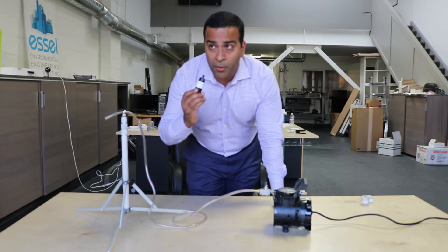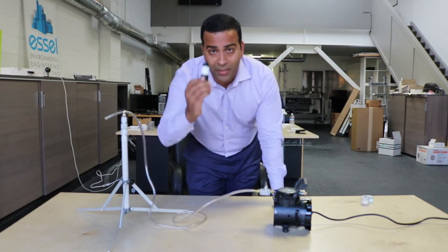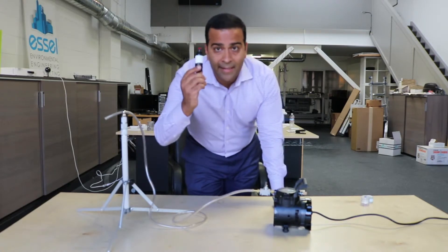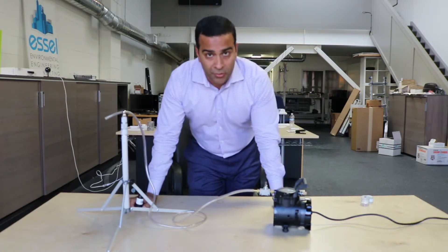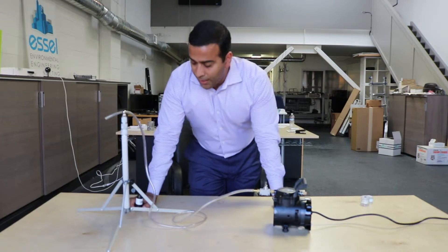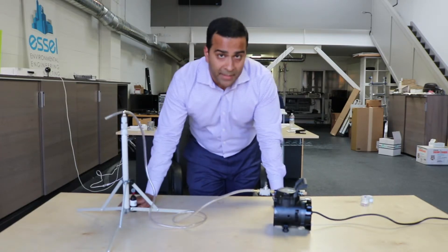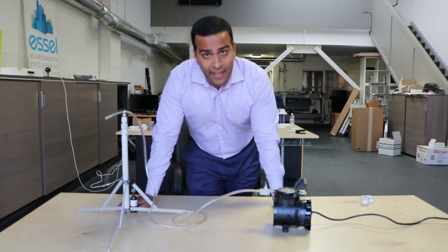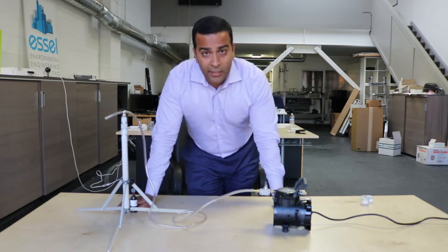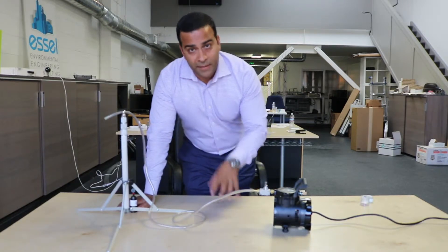The most important part of asbestos air sampling is what cassette is going to be used, and you have two different choices: you've got the PCM cassette and you've got the TEM cassette. I'll explain very briefly what the differences are.